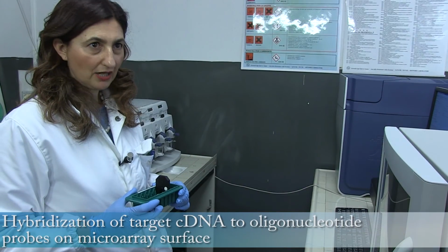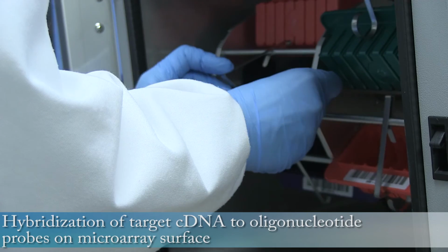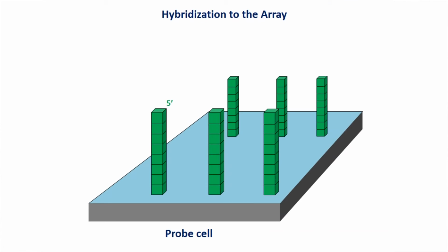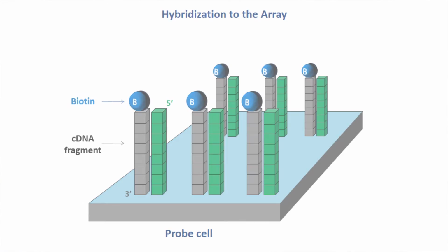After loading microarrays, they are incubated in a hybridization oven at 45 degrees with a rotation of 60 rpm for 16 hours. During incubation, sense target cDNA will hybridize to the corresponding antisense oligoprobes.